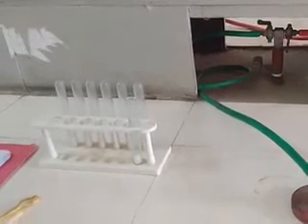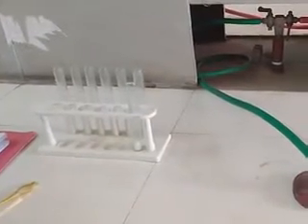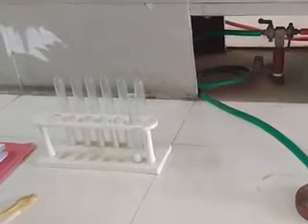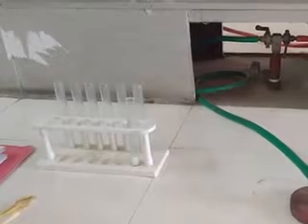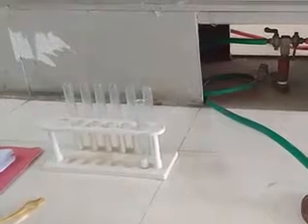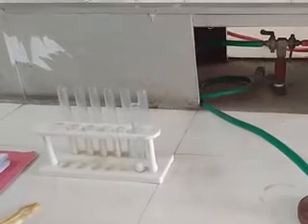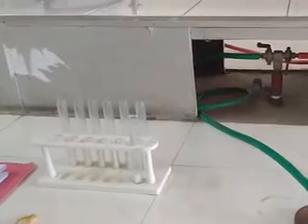Good morning students. Today we will be performing the qualitative organic analysis of a given organic sample. This experiment consists of three parts. The first part is the preliminary investigation of the given organic sample. The second part will be the detection of elements, which will be performed by preparing the Lassaigne filtrate. The third part will be the detection of functional groups present in the organic molecule.